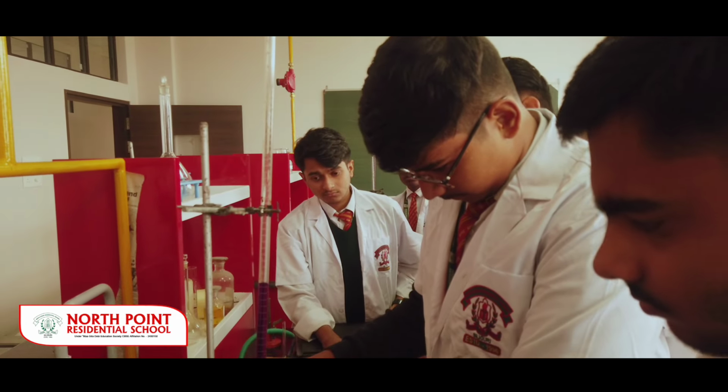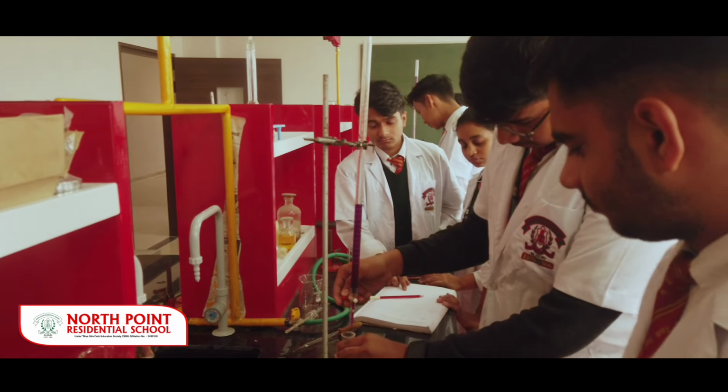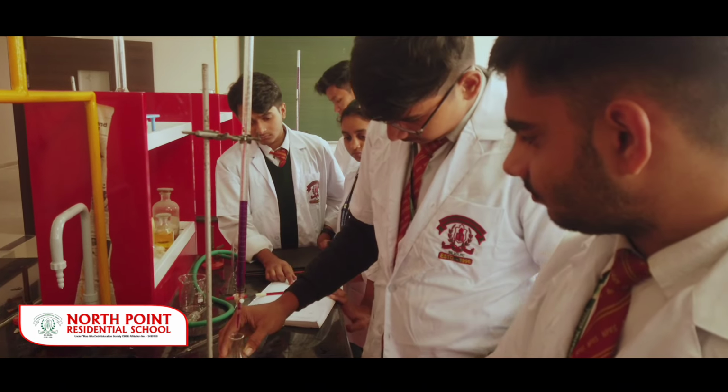Okay. So it seems like you all are busy and everyone is putting their best knowledge forward to help one another, and it's group work and everybody is doing the best they could.